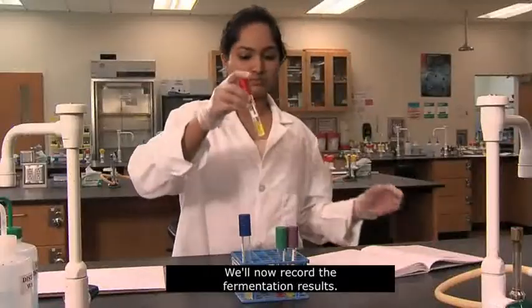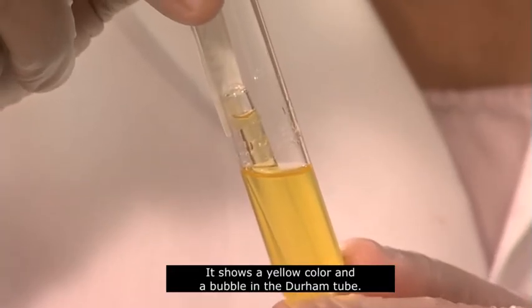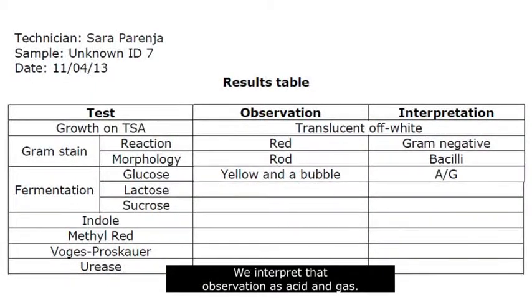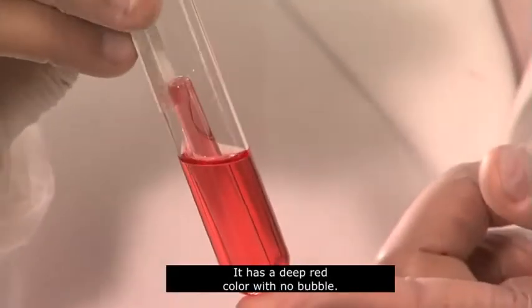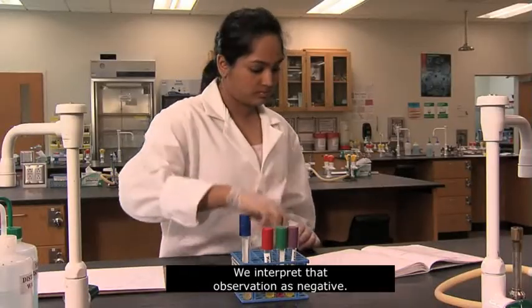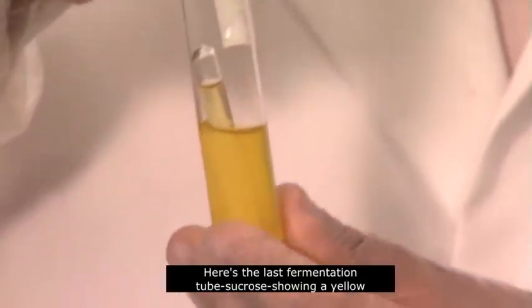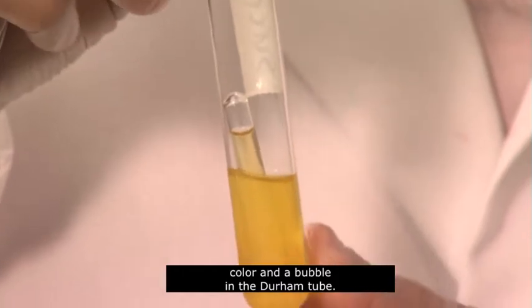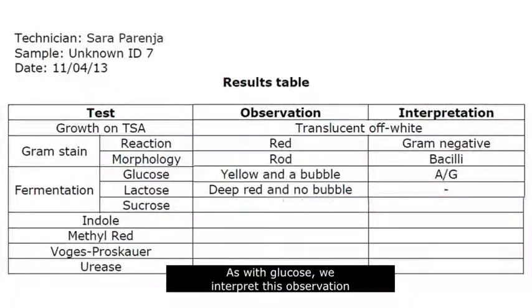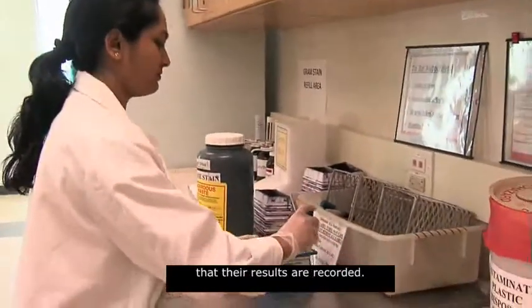We'll now record the fermentation results. Here's the glucose fermentation — it shows a yellow color and a bubble in the Durham tube. We interpret that observation as acid and gas. Here's the lactose fermentation tube. It has a deep red color with no bubble. We interpret that observation as negative. Here's the last fermentation tube, sucrose, showing a yellow color and a bubble in the Durham tube. As with glucose, we interpret this observation as acid and gas.